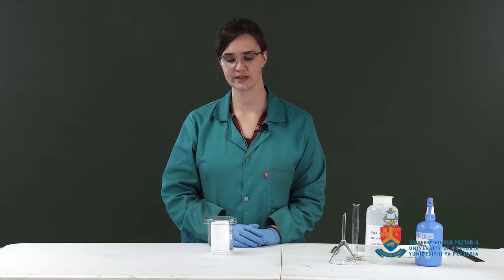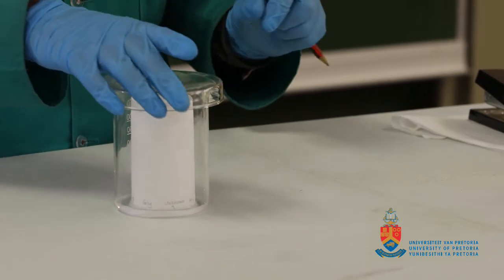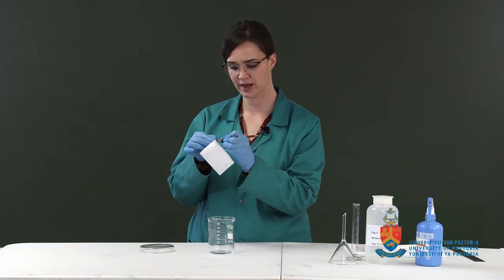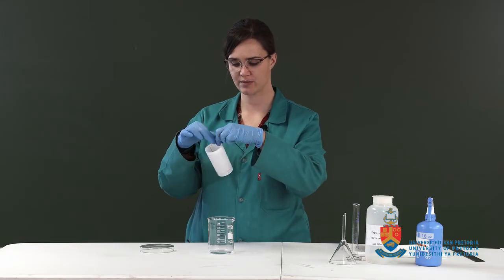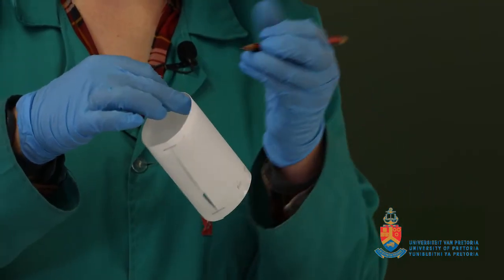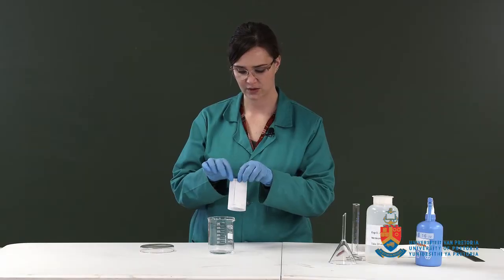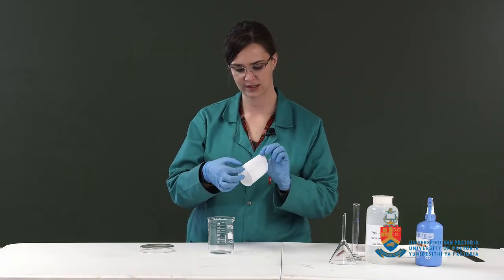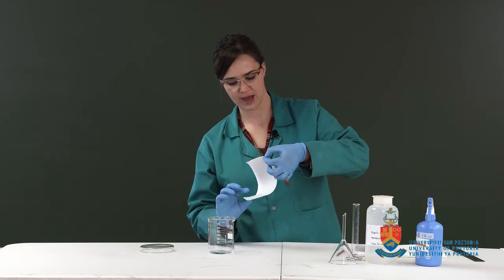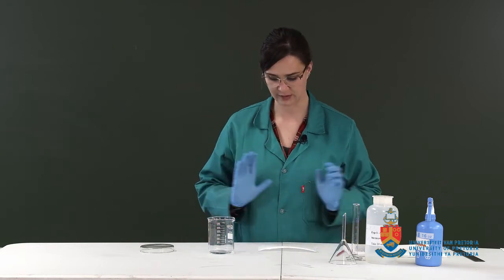Okay, so you can see the solvent front has moved up. So the first thing we need to do when we take it out of the chamber is mark with a pencil about 2 or 3 marks where the solvent front is, because this is what you need to determine your RF value. So we can just rip out the staples, because that's not a very important part of the chromatogram, and we lay it face up on the desk and we wait for it to dry.